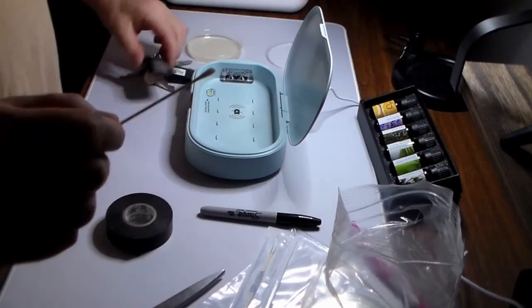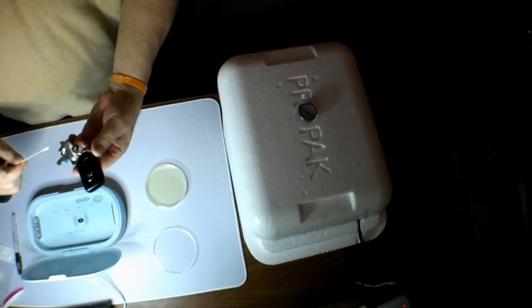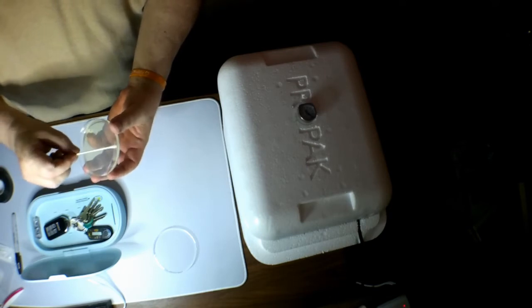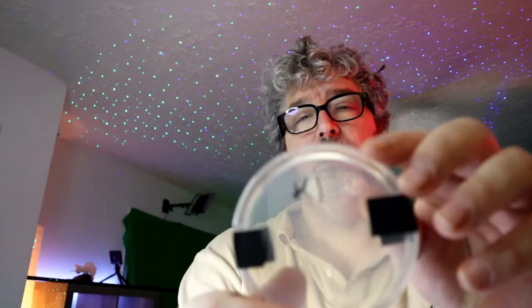I don't know what part of this to do, so we'll just swab a few keys and the fob for my car. Alright, so let's swab the fob. That's funny. Swab a key or two. And it's in. Alright, let's run the keys. See what happens.